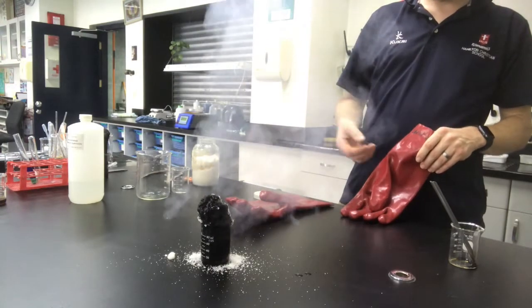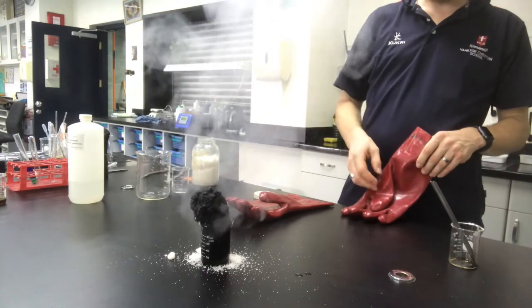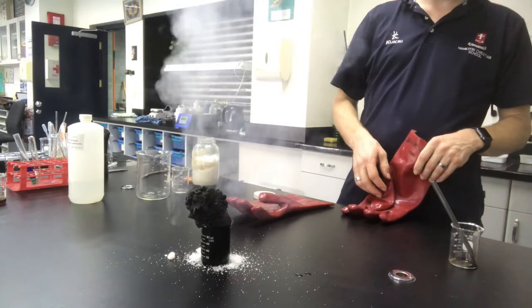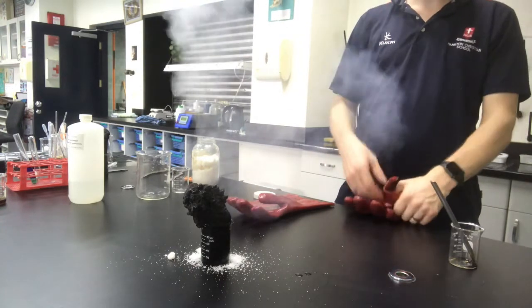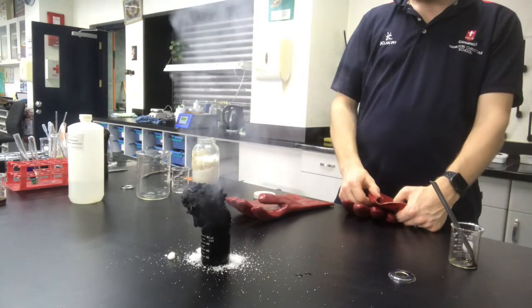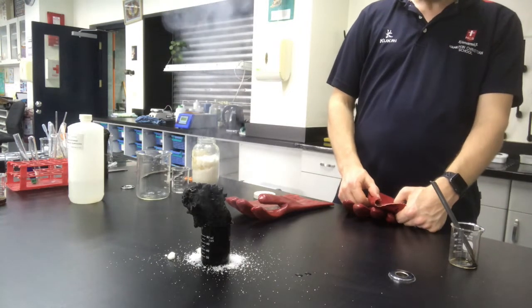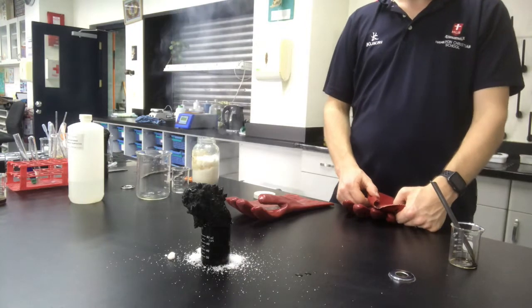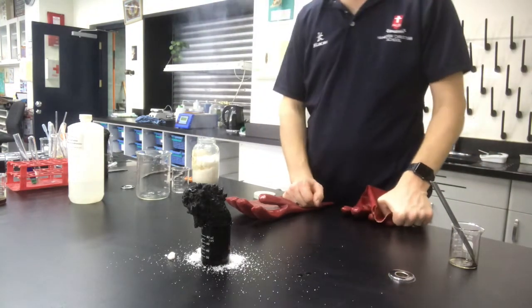So what you can see coming off here is a lot of steam, so it's an exothermic reaction. We're producing a lot of heat, and it smells a lot like burnt marshmallows. We can definitely see it's got some heat coming. So it just took a little bit of time there, obviously, to get nice and warm.